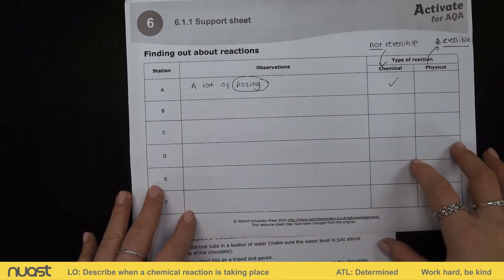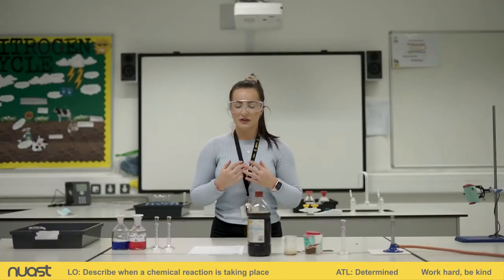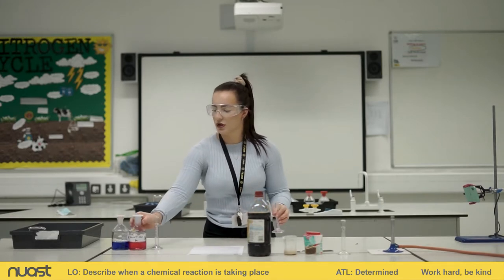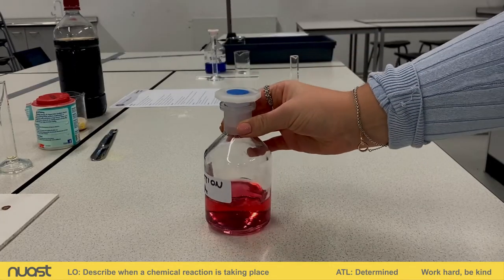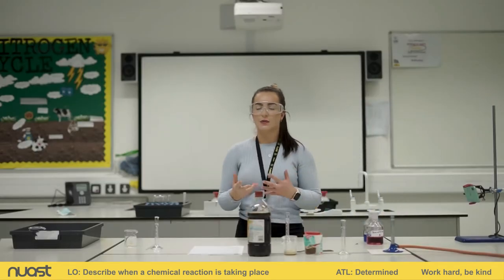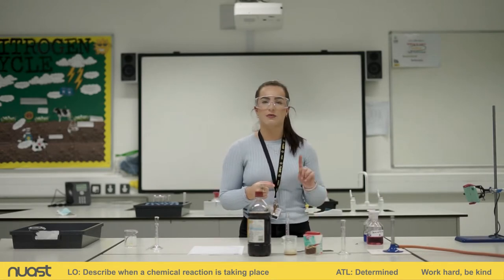Please make sure you've got the support sheet open and you can be filling in the table as we go through. We're going to have a look at station B now. Station B says to measure out five centimetre cubed of solution A — which is a red solution — using a measuring cylinder. Then we're going to add five centimetre cubed of solution B, which is a blue solution, and see what happens. Make a prediction in your head: what do you think we might see when we add our red solution A to our blue solution B?